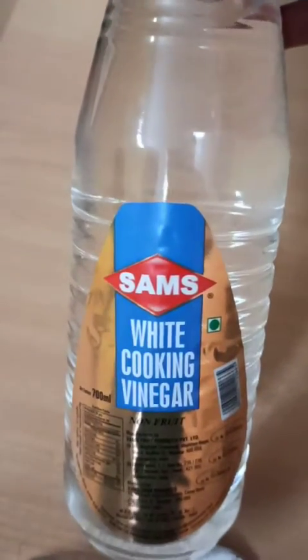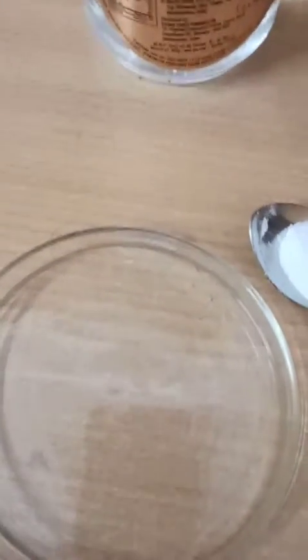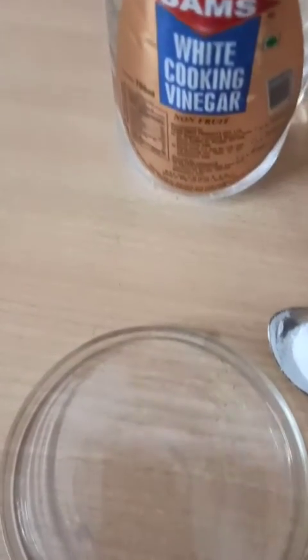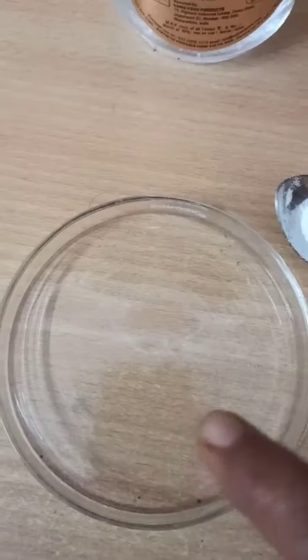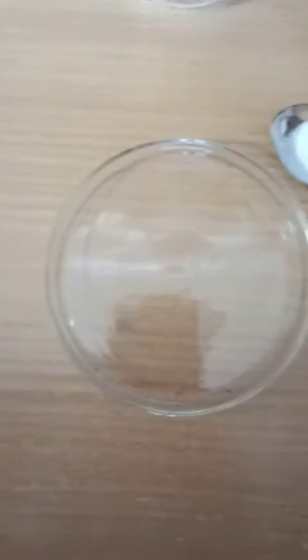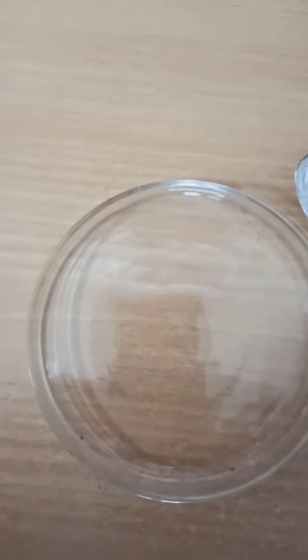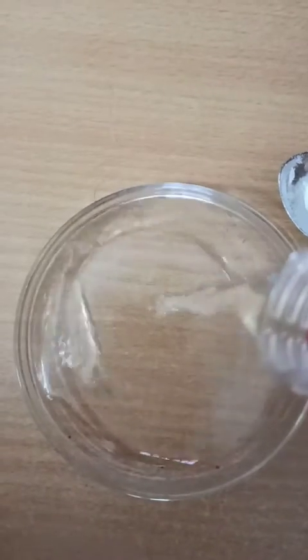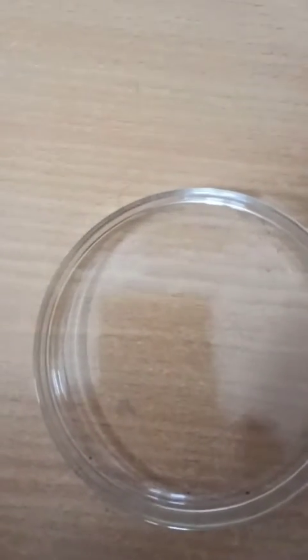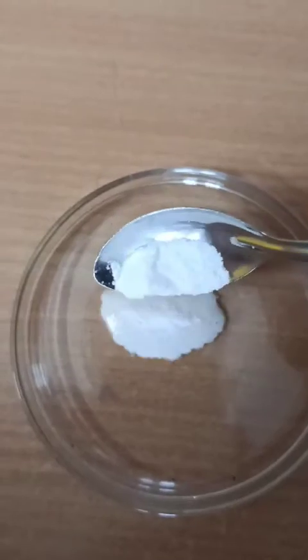This bottle contains vinegar, which is acetic acid. I'll take the vinegar from this bottle and put it in this petri dish. You can see the vinegar I put in the petri dish — it is transparent. Now I add baking soda to it.